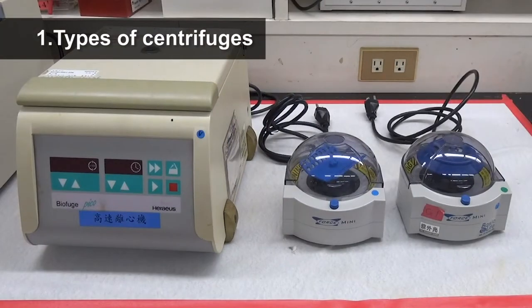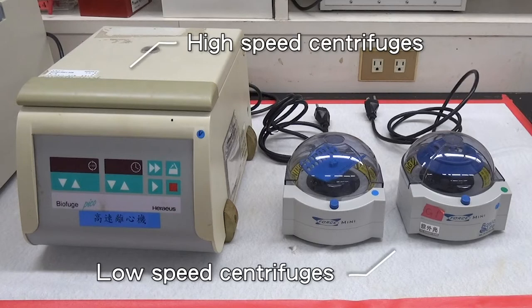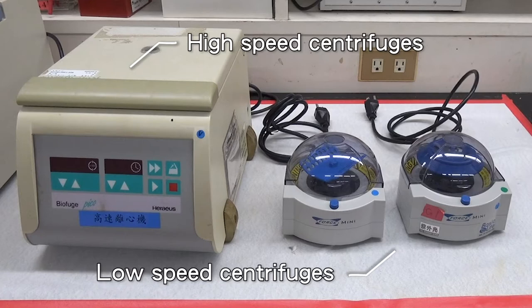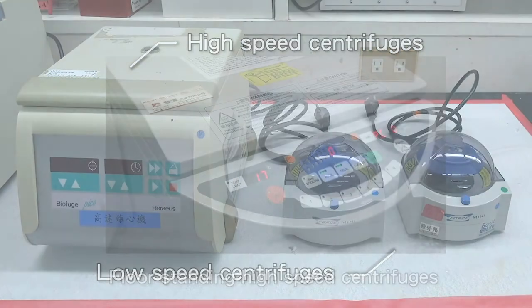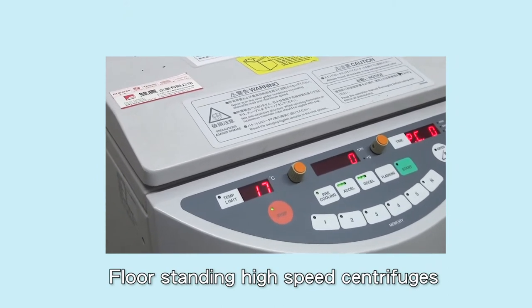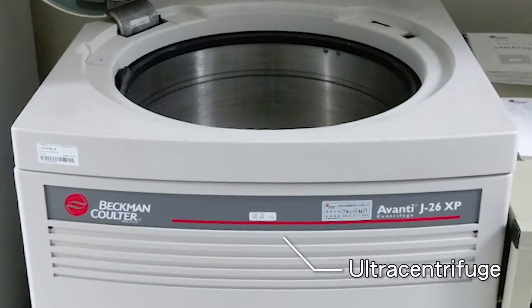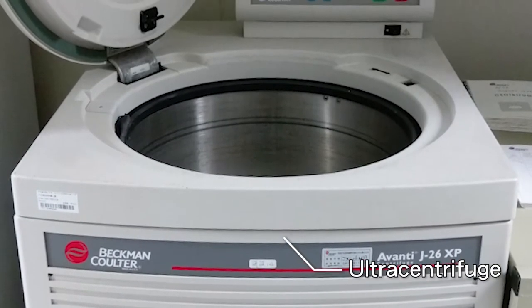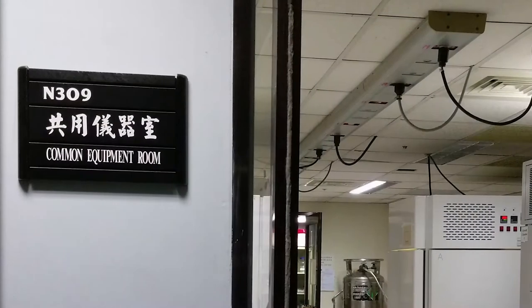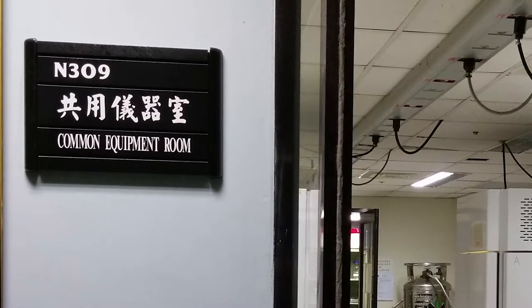Types of centrifuges: Centrifuges commonly used in laboratories include tabletop low-speed and high-speed microcentrifuges that are designed for microcentrifuge tubes, and floor-standing high-speed centrifuges designed for various centrifuge tubes. As for ultracentrifuges, since users must receive training to operate, they are mainly found in common equipment rooms under the management of an administrator.